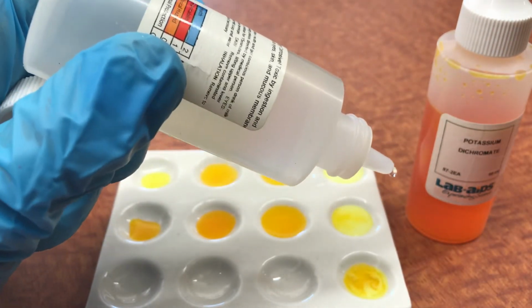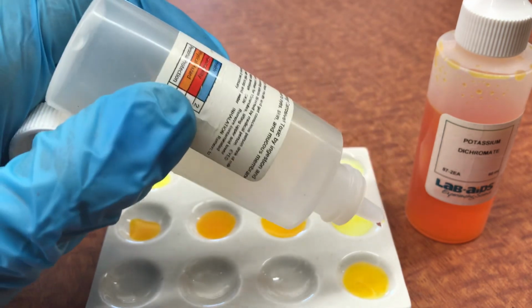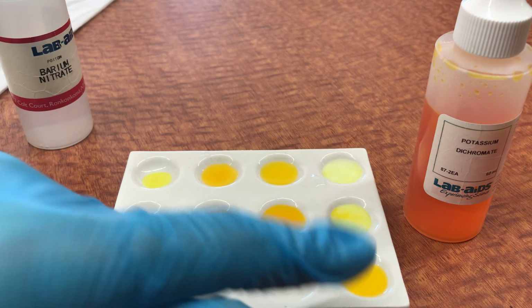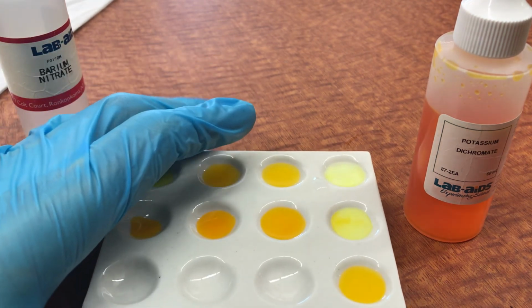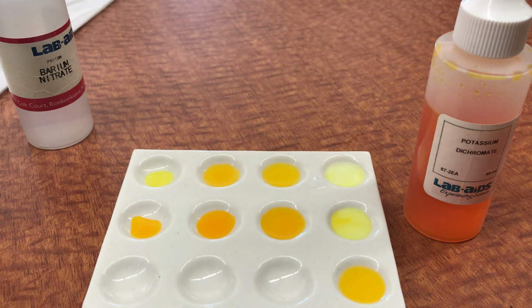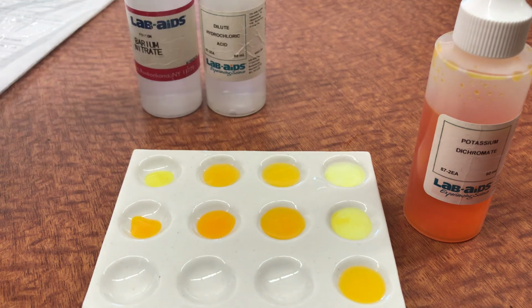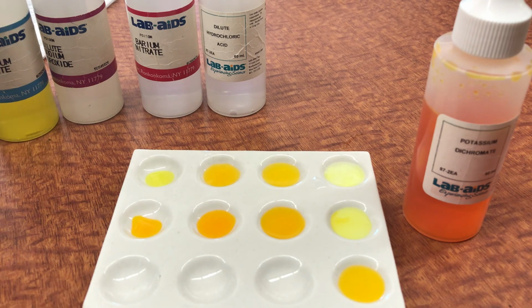And there you go, look, I can make the solid go away by using an acid. Although there is a little bit of barium dichromate, I believe, there at the bottom. It's not nearly as clear as it was a second ago. Oh, no, it's pretty clear. So that's equilibrium. We're just playing with it by manipulating it, and we'll talk in the follow-up section about what these chemical reactions must look like.